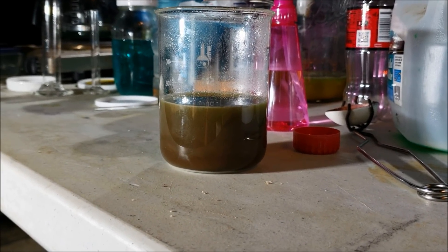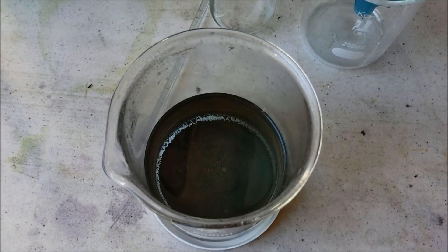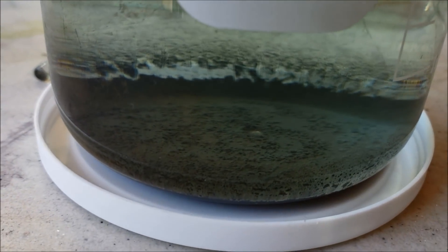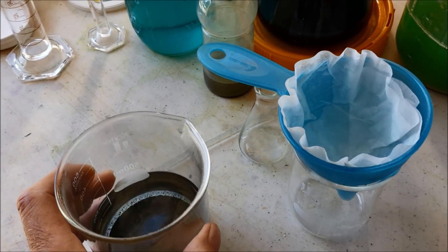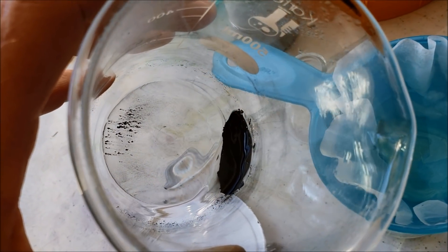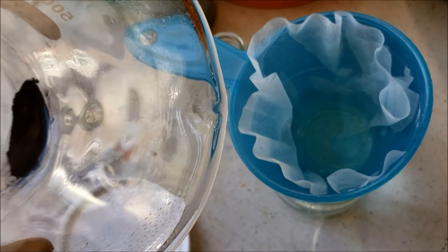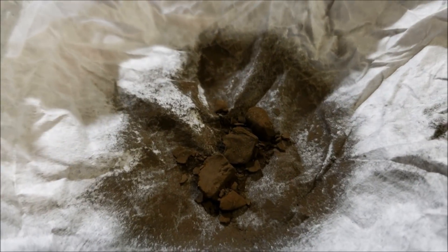It's really turned. As you can see, it's now just clear liquid with gold dirt on the bottom. Now we're just going to filter this — this time we're going to keep the dirt, not the spent aqua regia. We'll filter it through a filter, and that's my gold dirt. Get all that in the filter, rinse it with distilled water, and then burn it. There's my gold dirt after we filtered it.